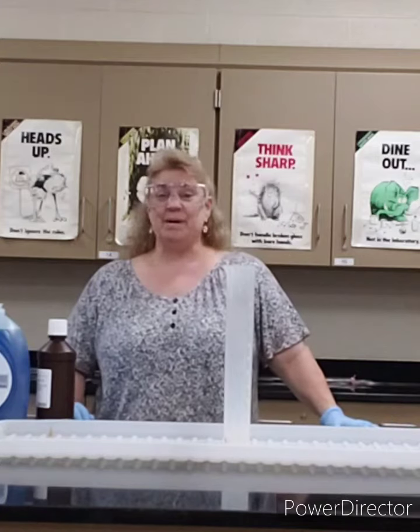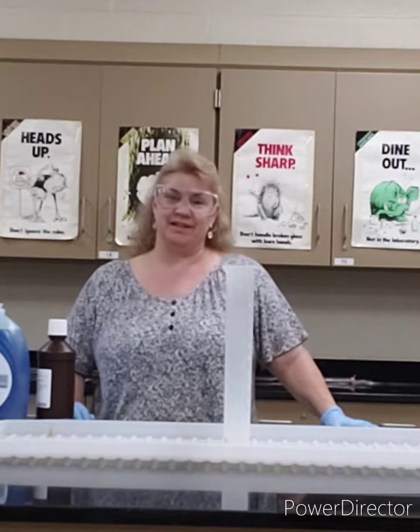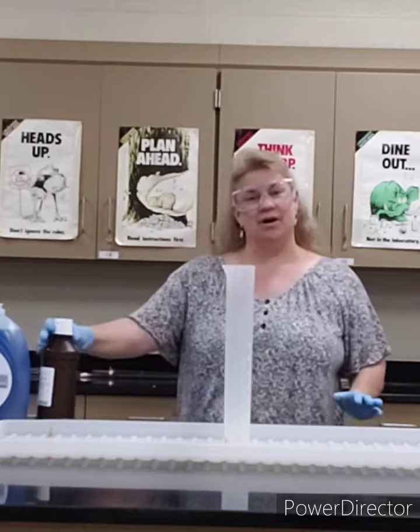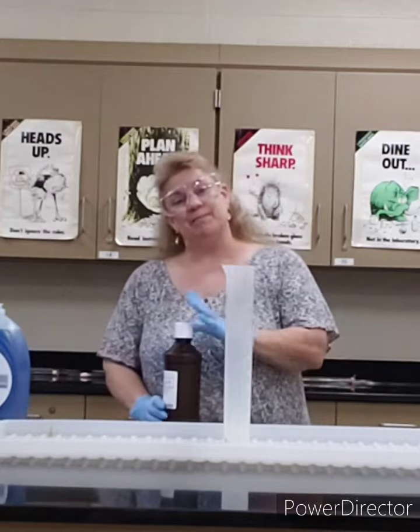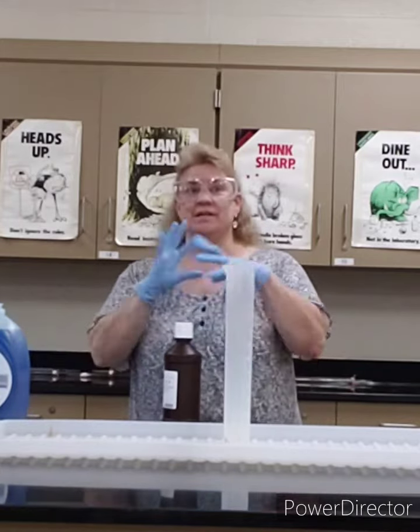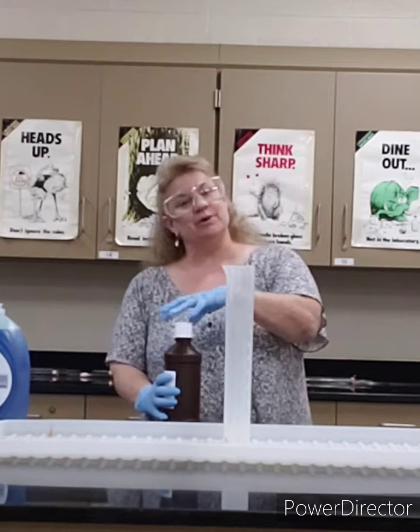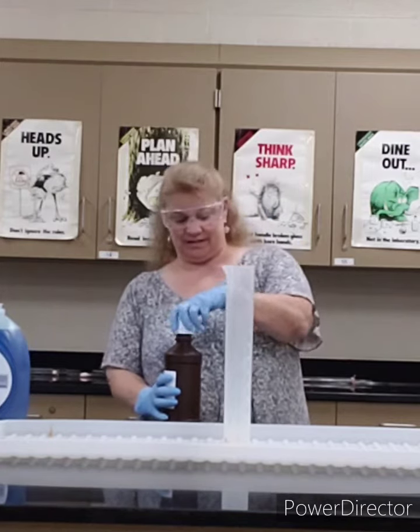Welcome to my mixtures demonstration. Today we're going to take hydrogen peroxide and mix it with soap to make an emulsion. It's also a good demonstration of catalysts.